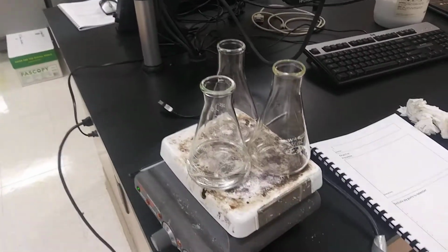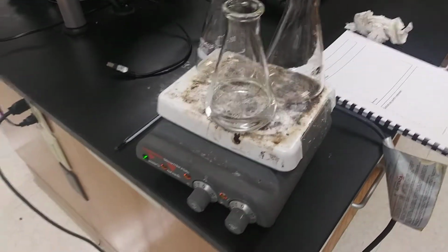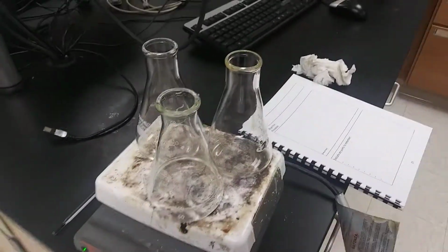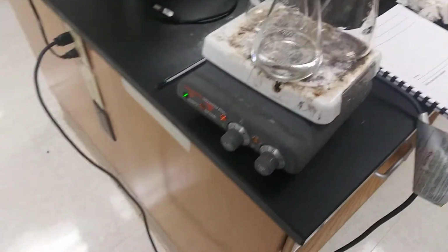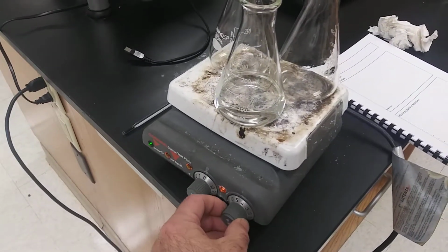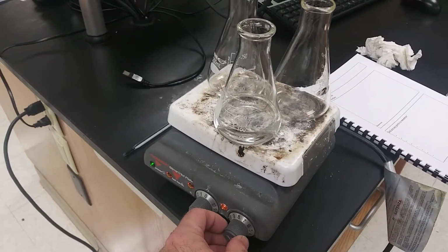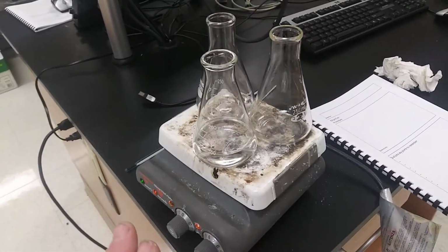So a couple of things I just mentioned. One, we always do multiple trials in a row. So how does this hot plate work? Well, first of all, when I turn it on, make sure I'm turning on the heater, not the stir plate. That's a stir. This is the heater. Now this thing here is a bit like a freight train. So I'd probably turn it up to 7, 8, 9, and it's going to get real hot real fast.